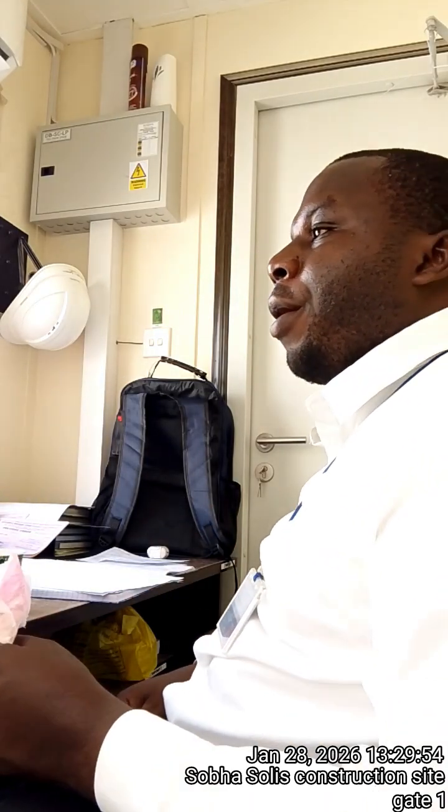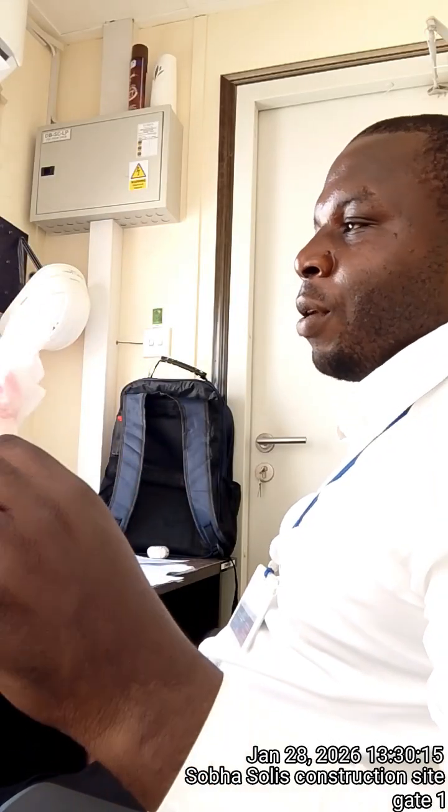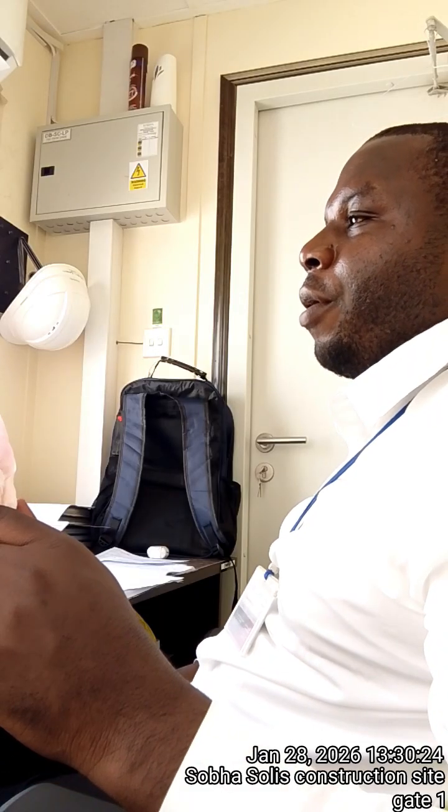Therefore, in my conclusion, this water is neutral water, because when you look at the pH of the drinking water I have, it is 7.2, making it slightly alkaline. But with this one, I cannot determine whether its pH is base or acidic. Meaning that it is between neutral and alkaline.